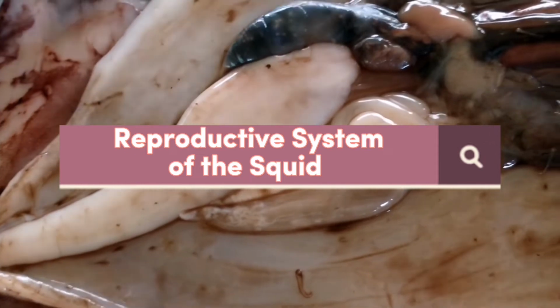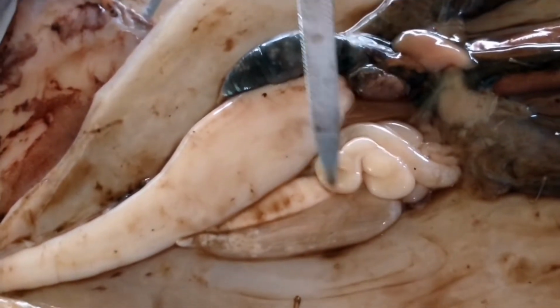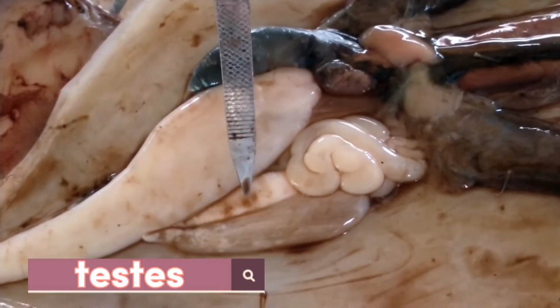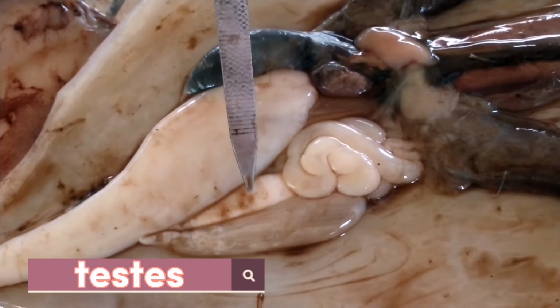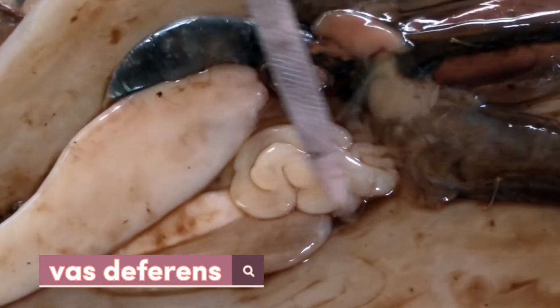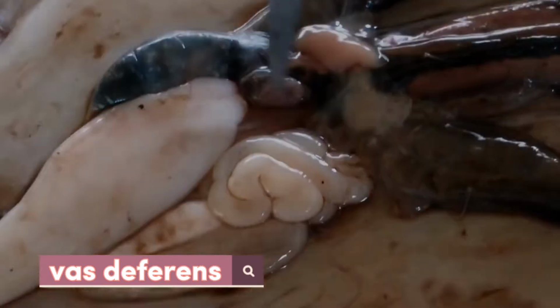Now let's move to the reproductive system of the squid. And this part is the reproductive system of the male squid. And right over here is the single testis visible in the reproductive system of the male squid. And this tube right here is the vas deferens of a male squid.